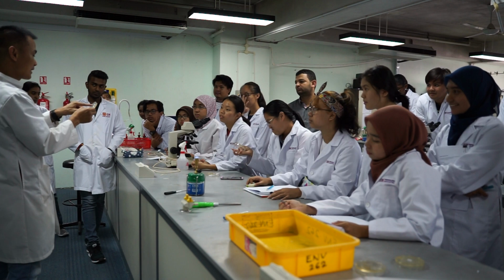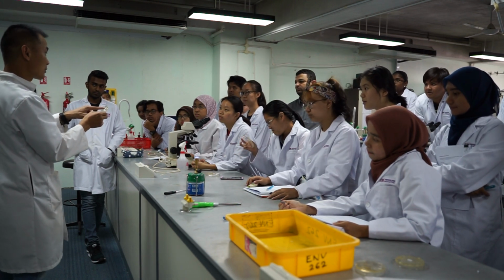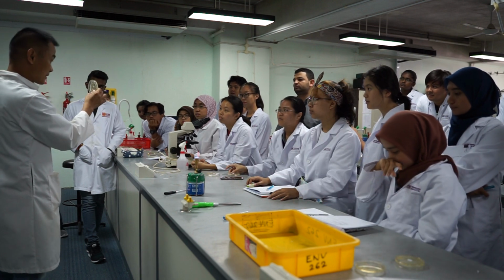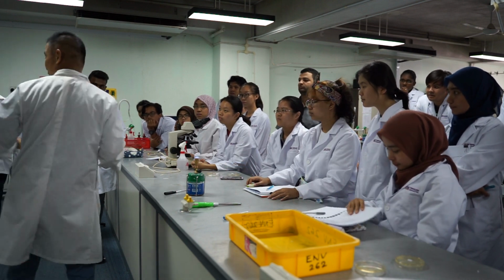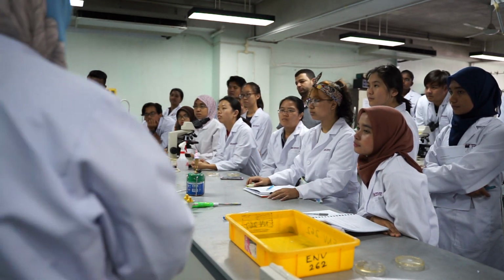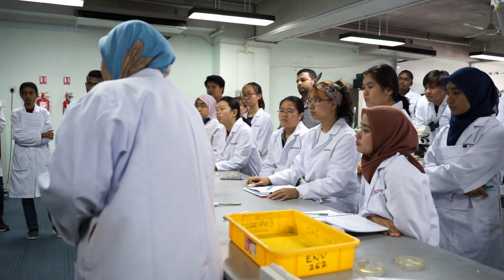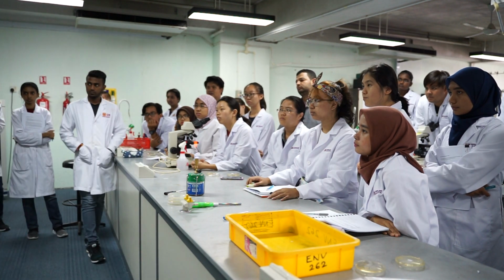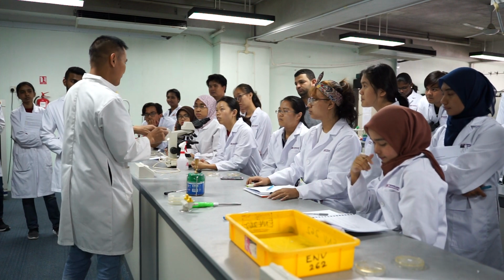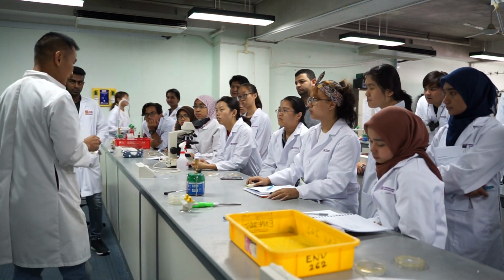So if you say that this bacteria is going to be able to remove whatever pollutant is, you do not know, because there are going to be a lot of them. You want all single species. So what you're going to do today, like we said, you're going to streak them, and then basically by streaking, you do serial dilution, dilute them, and then at the end, you're going to get single species here and take it out. Okay? But in reality, this is also almost like a single species. That's it from yesterday, to isolate it.